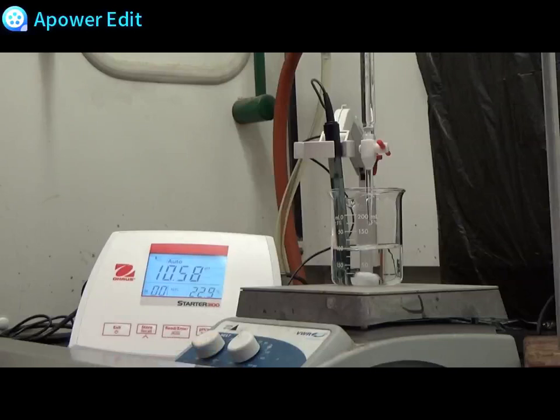I have recorded all of the data points. Now I can plot the volume of sodium hydroxide versus the pH where the total volume of sodium hydroxide will be on the x-axis and the pH will be on the y-axis. We have completed the titration. Next I will show you how to do the exact procedure but to collect data for an unknown amino acid.